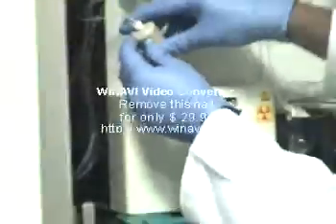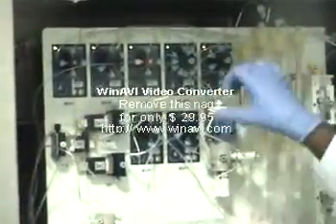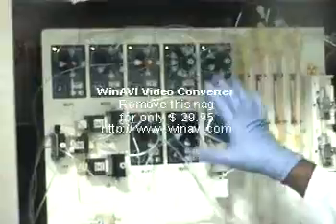The valves are MEP 7, MEP 6, MEP 5, MEP 4, MEP 3, 2, and 1. We use these valves to control the flows as required. And these are the purification columns, which play a key role in the synthesis procedure.